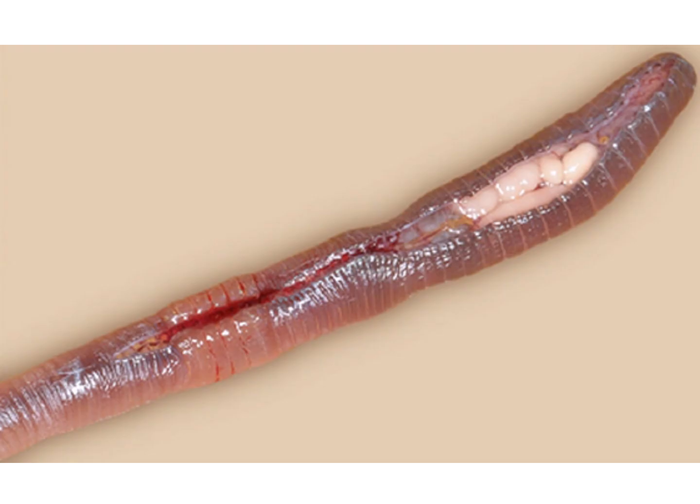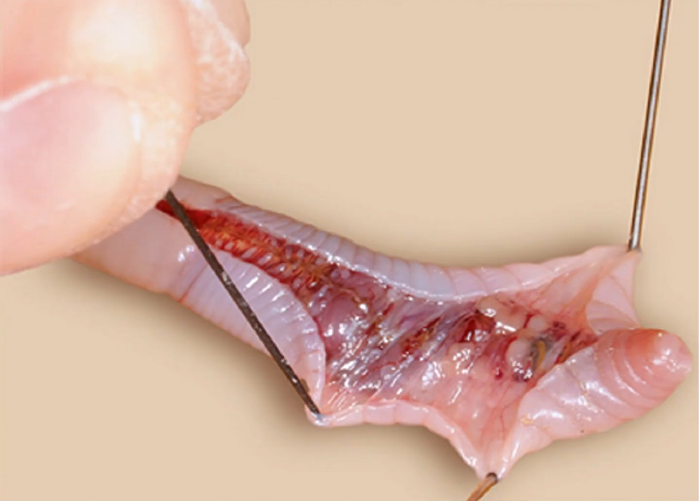In the cut earthworm in the dissecting plate, we can see internal organs. They are the seminal vesicles and the spermatheca. They are visible, these white structures. On the anterior side, we start placing the pins on both sides opposite to each other.